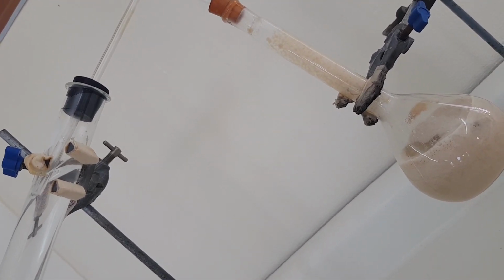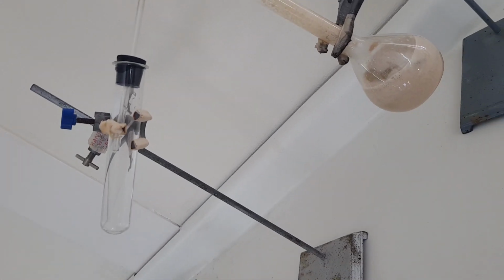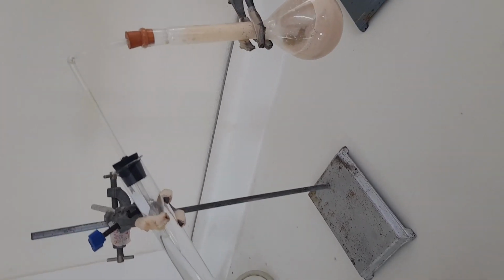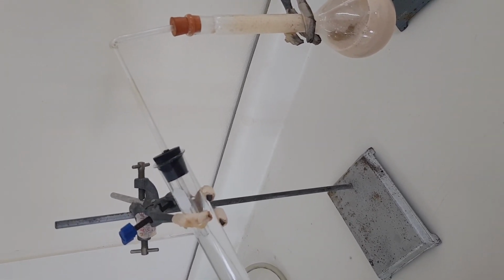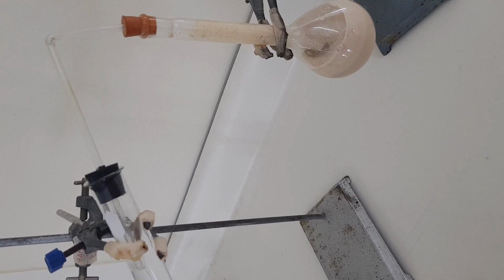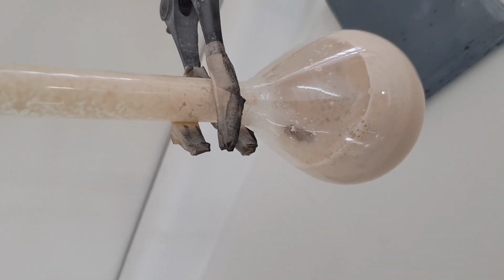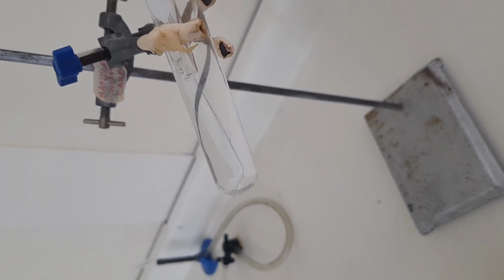So that you could see in both containers what's happening. Probably a little clearer there too. Here we should be seeing the effervescence going on in the flat bottom flask, and how quickly or rapidly, or if it's slow or however fast that's occurring. And then this is our lime water here.